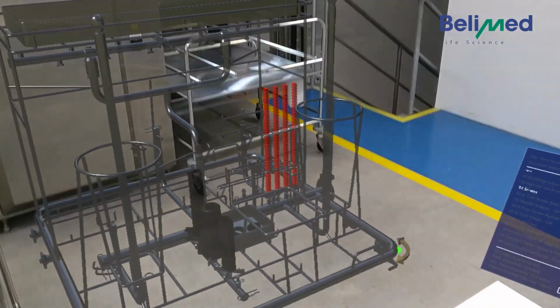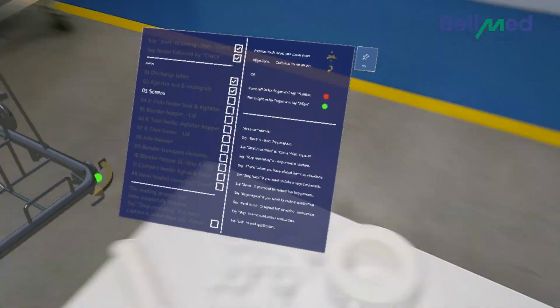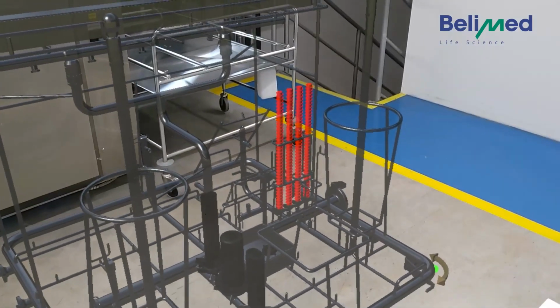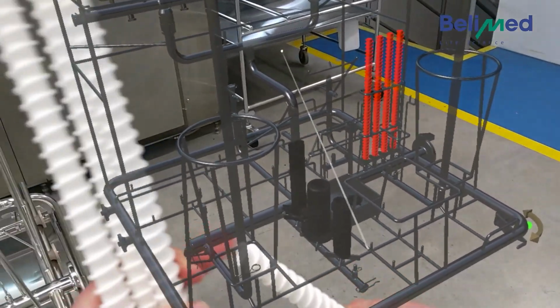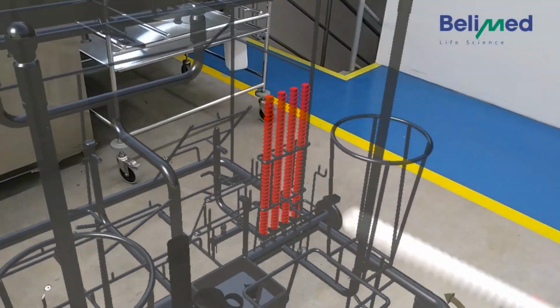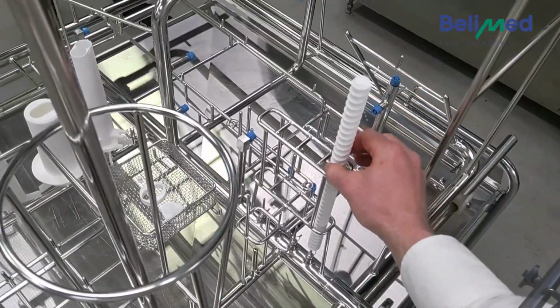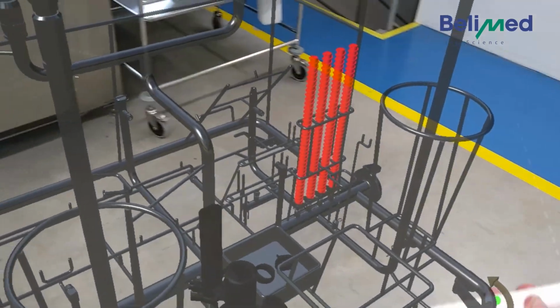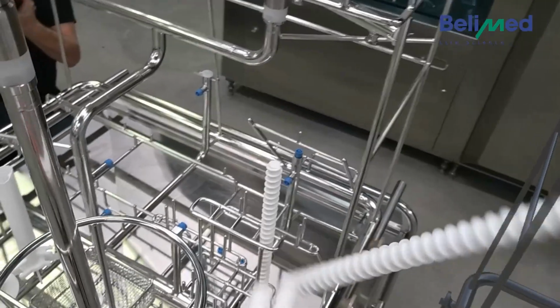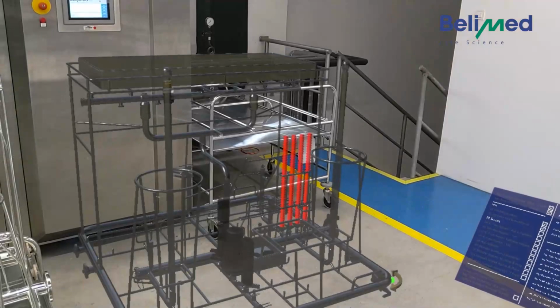So now we have these four parts we have here on the table. And now we can add audio guidance to, for example, say like, look, here on this side it's closed, on that side it's open. Make sure that the open part is faced to the bottom. So this can be added. It's really up to the customer's wishes. Check.